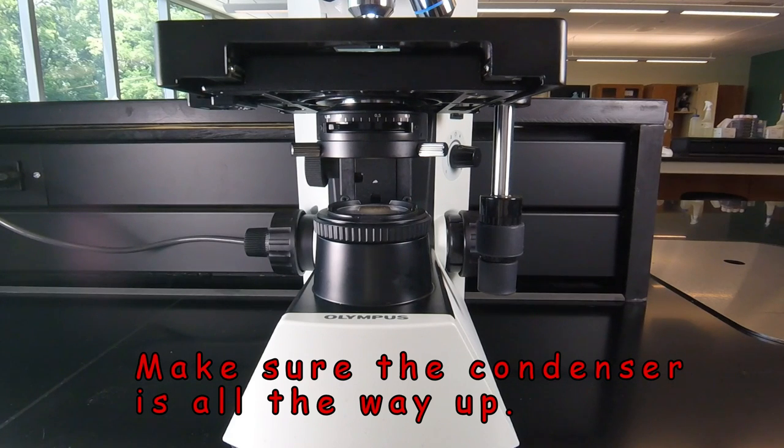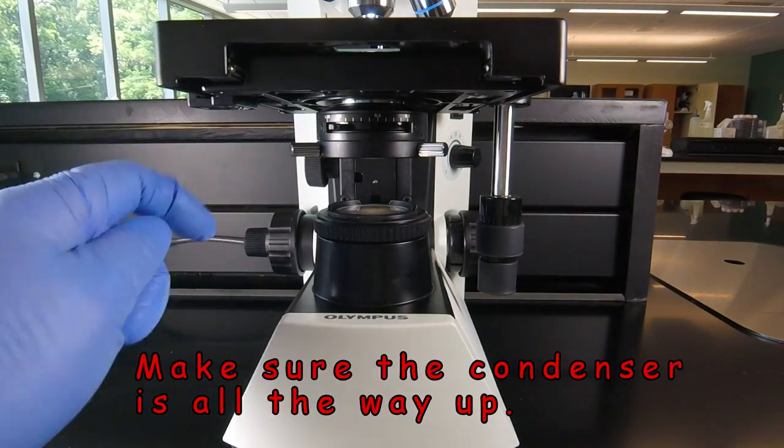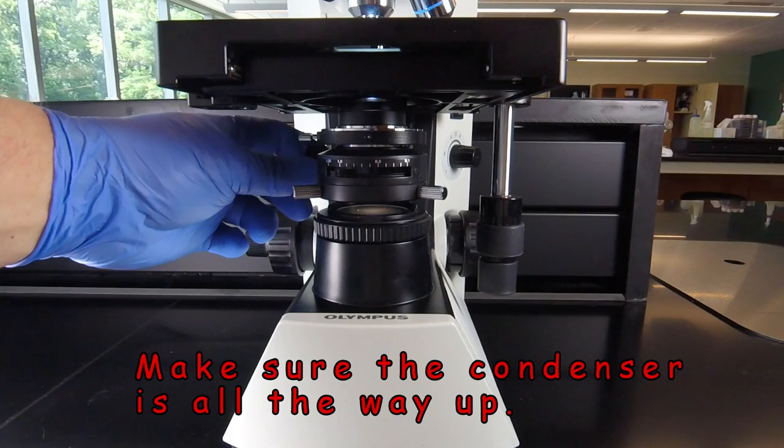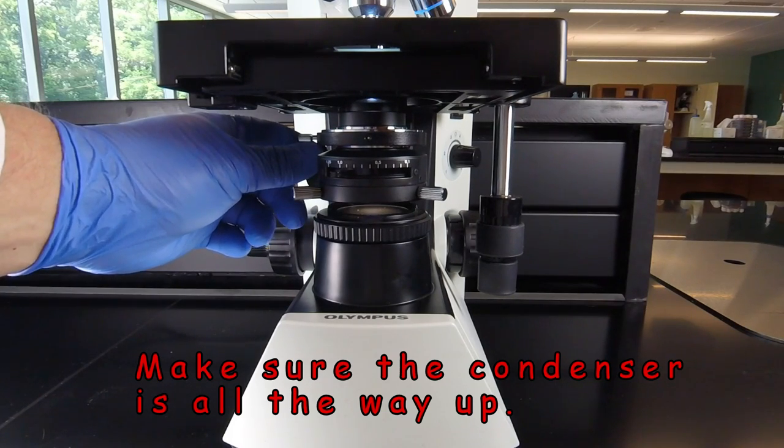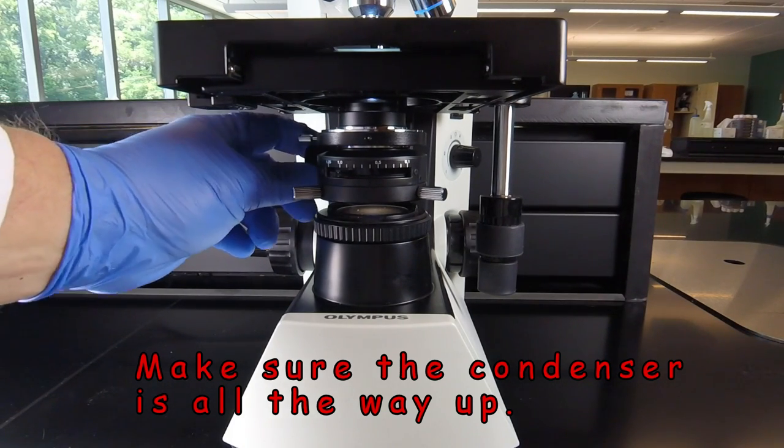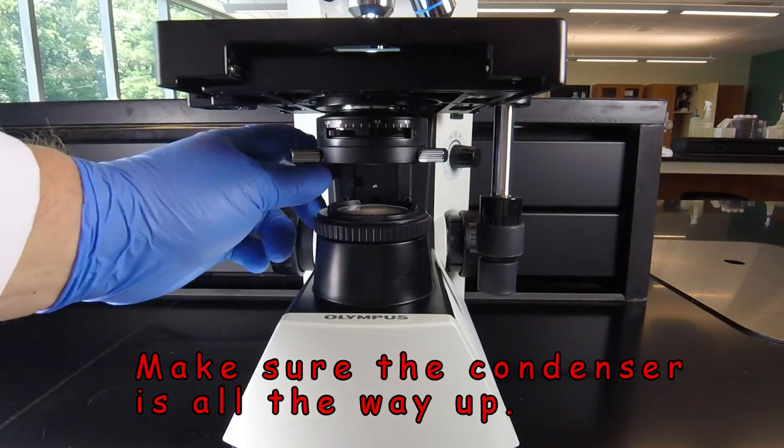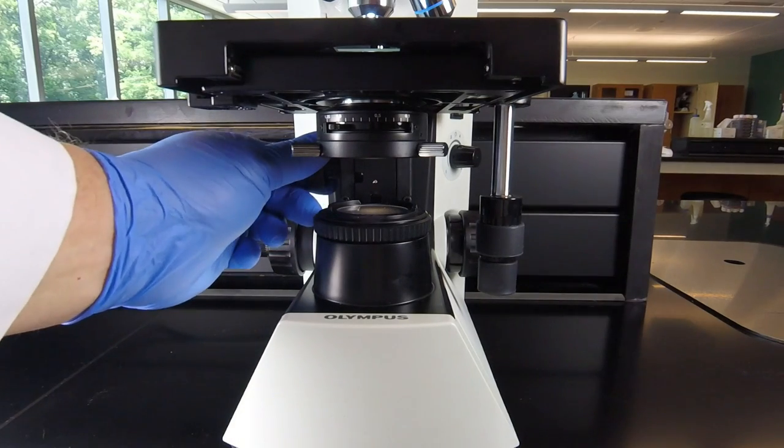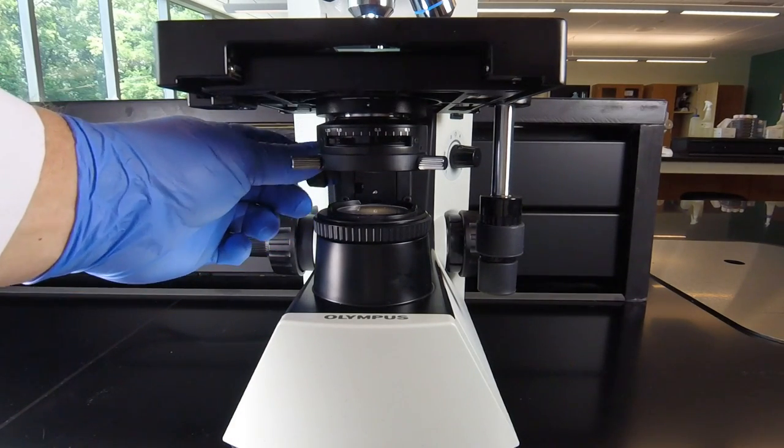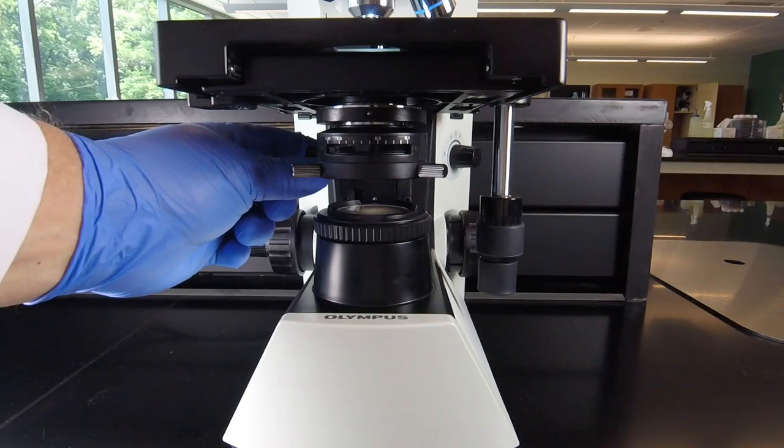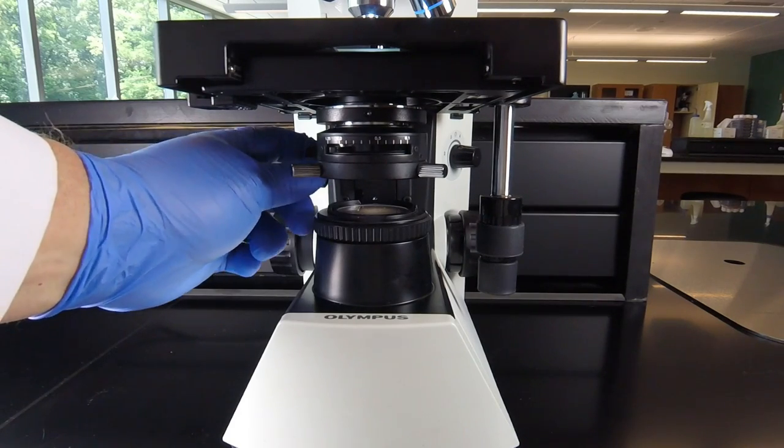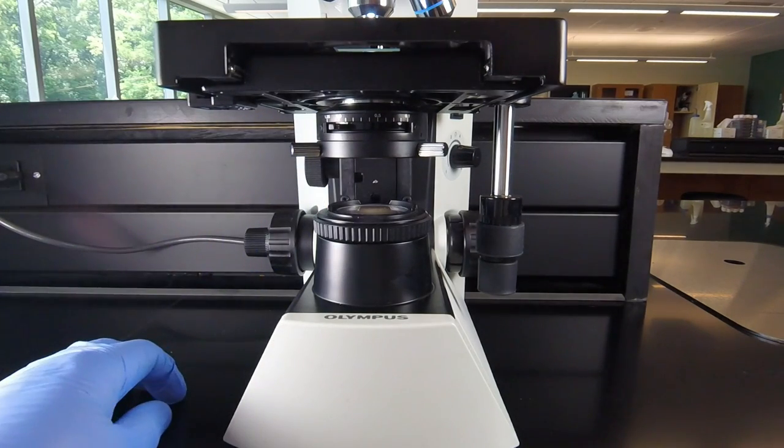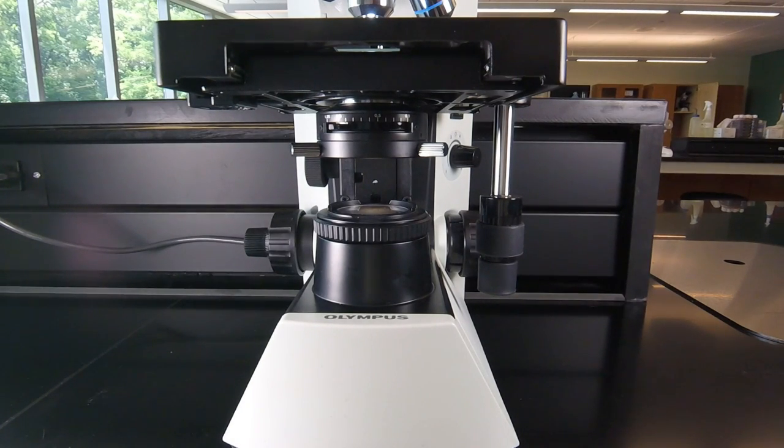And also we want to make sure that the condenser of the microscope is all the way up. As we mentioned, the condenser is right here, and there is a knob that lowers the condenser, so we can use that for changing or cleaning the condenser. But that needs to be up as high as it will go. Occasionally, someone will be reaching for the focus and grab the condenser knob by mistake and begin lowering it and decreasing the amount of light coming through. So always check just to make sure the condenser is all the way up, and that's where it remains when we're using the microscope.